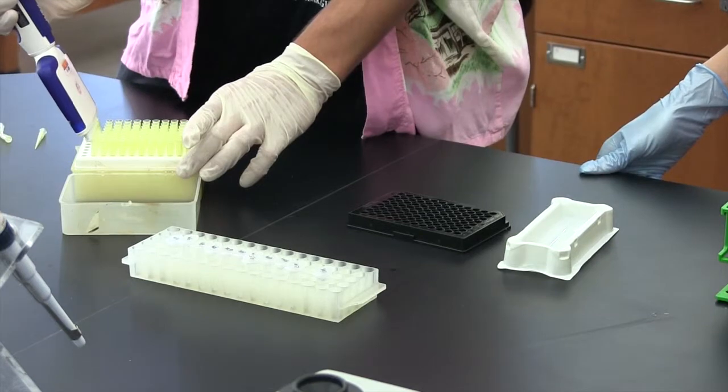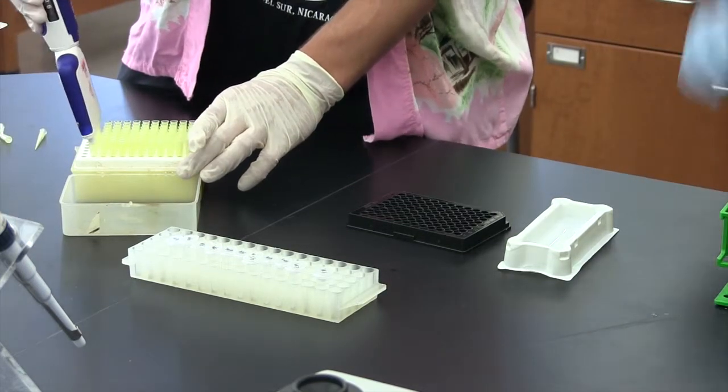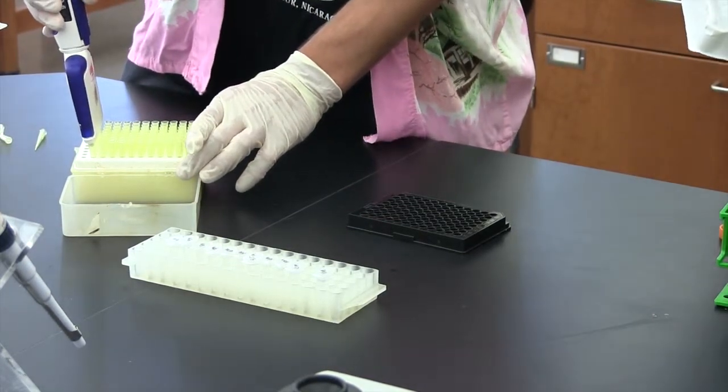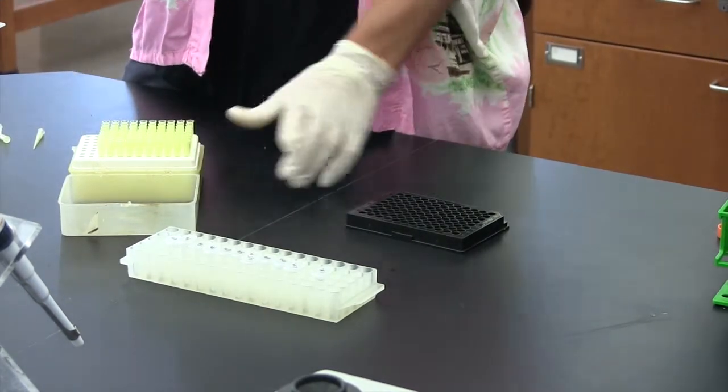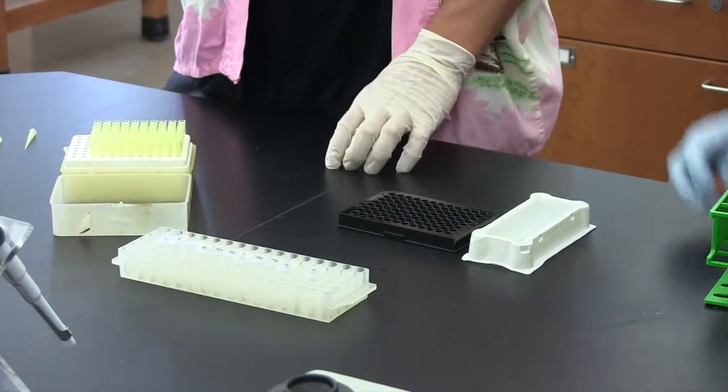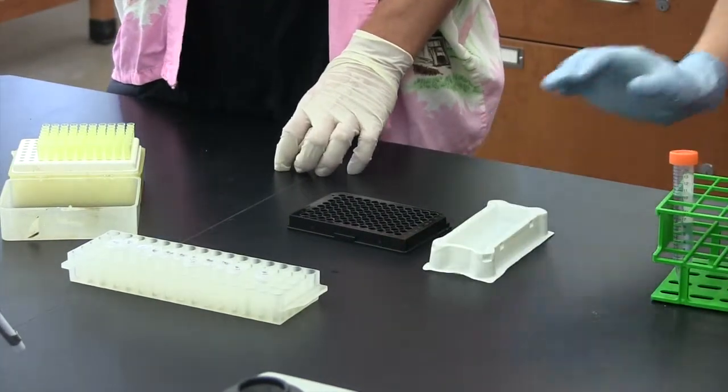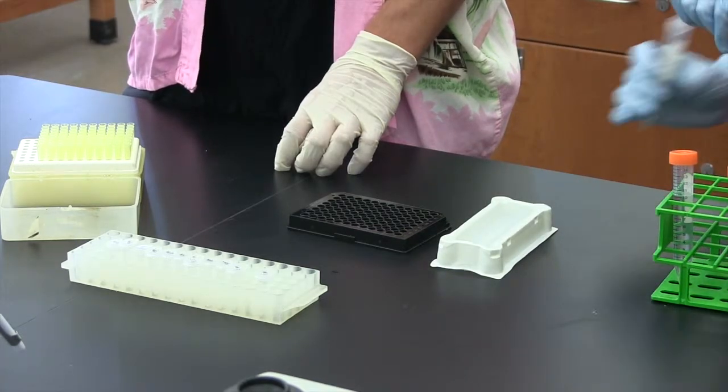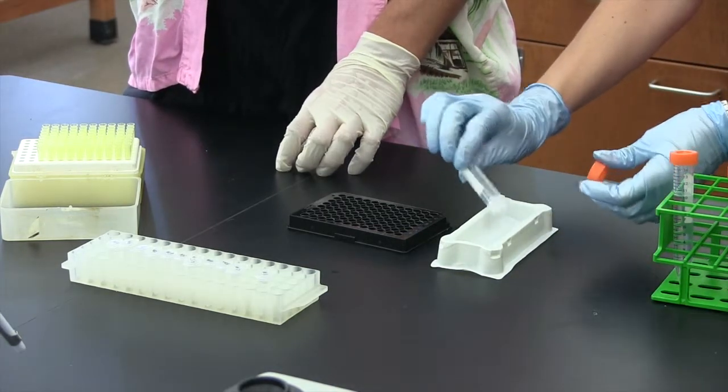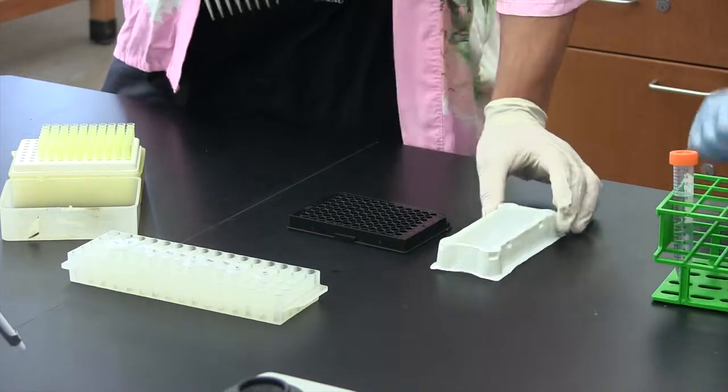And then I'm just going to be doing the exact same thing for my other samples. And you don't have to use a different of these each time. You can just kind of, actually the liquid pours out pretty well. You can kind of wipe it out with a kim wipe or rinse it with water if you think you need to.